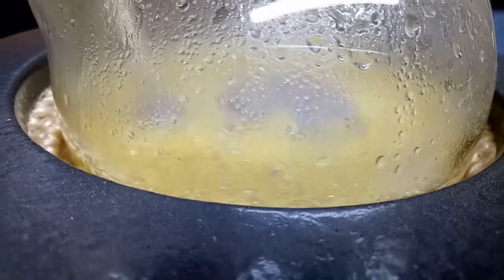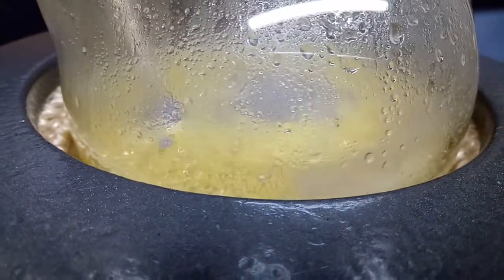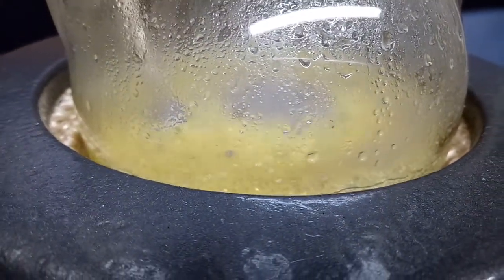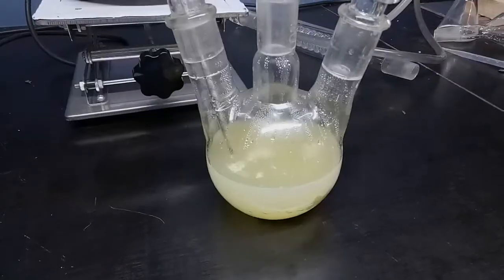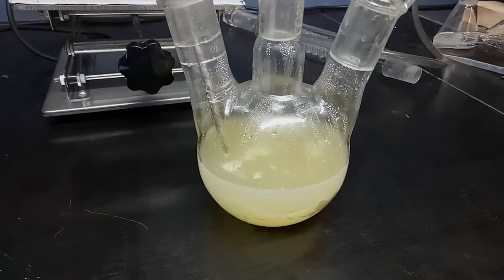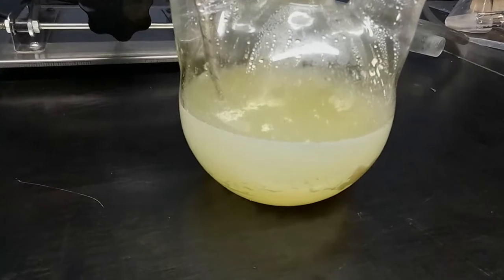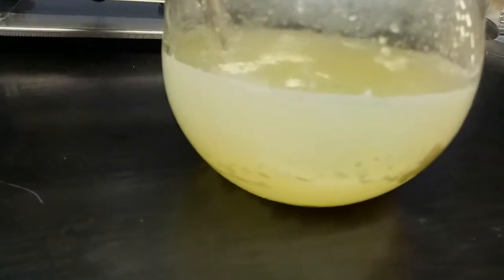I added it slowly over a period of two hours, and then I let it settle overnight. This was probably a really bad idea. By the next day, that oil was gone. Maybe it was over-oxidized to form benzoic acid, but we'll find out.